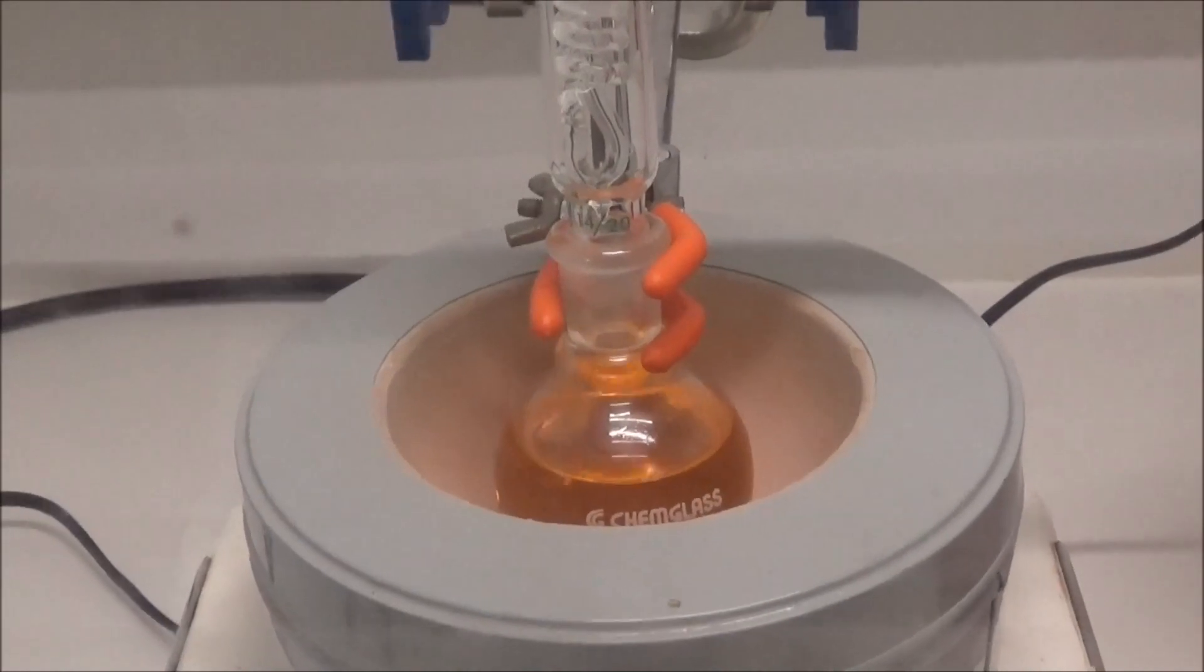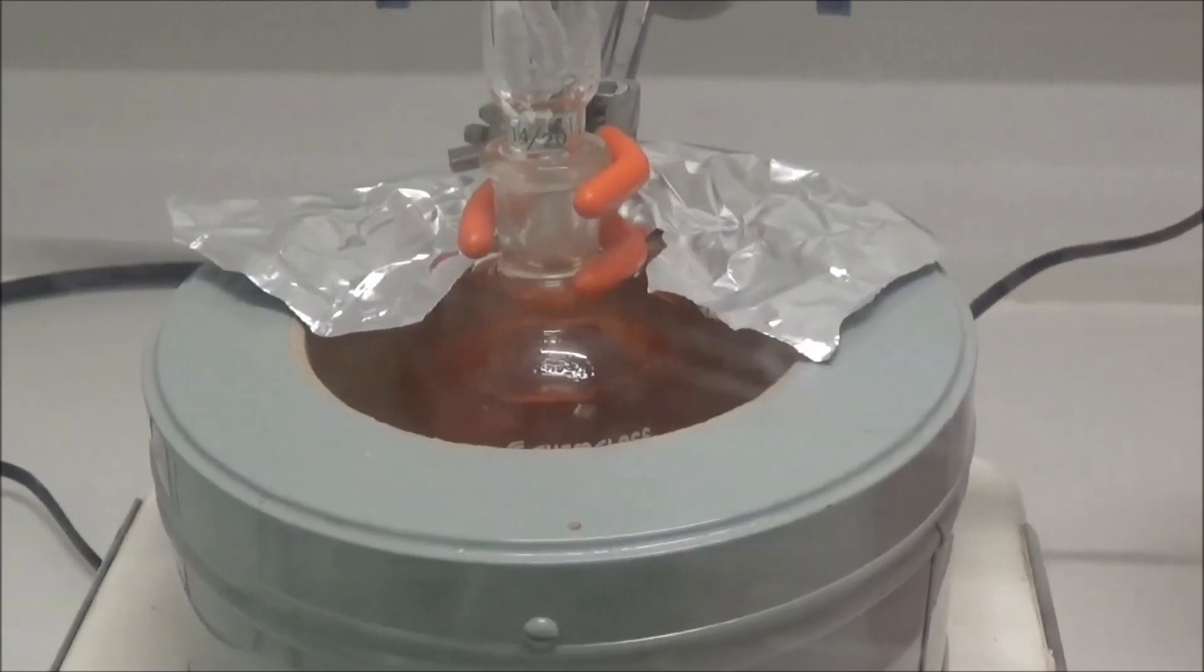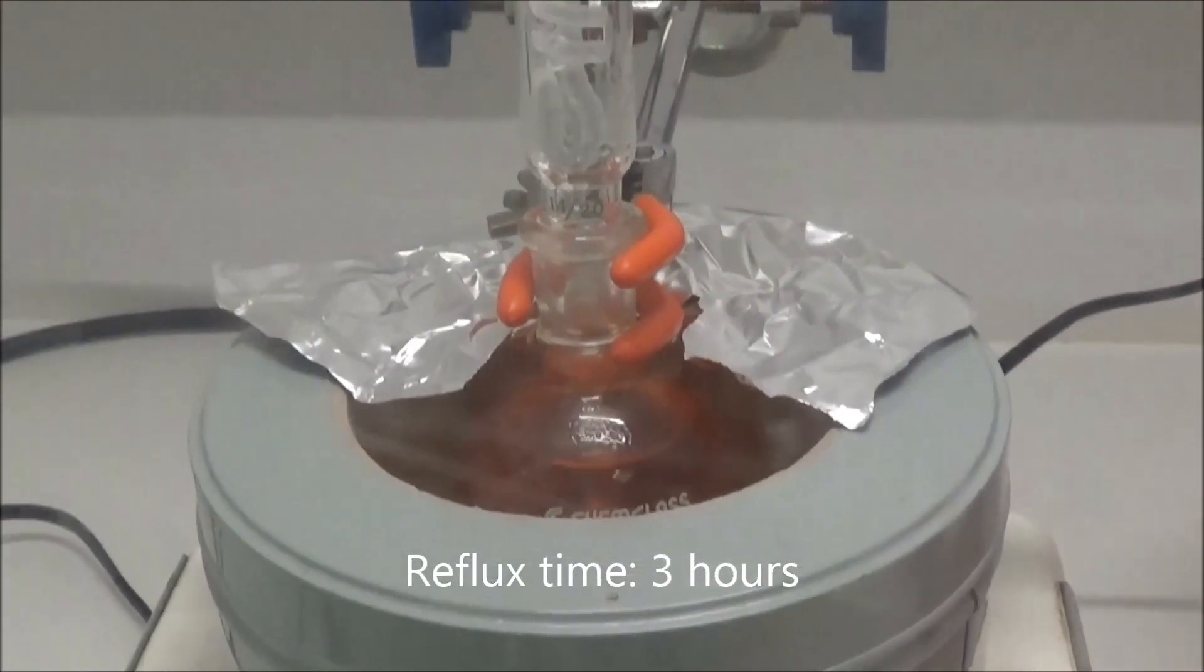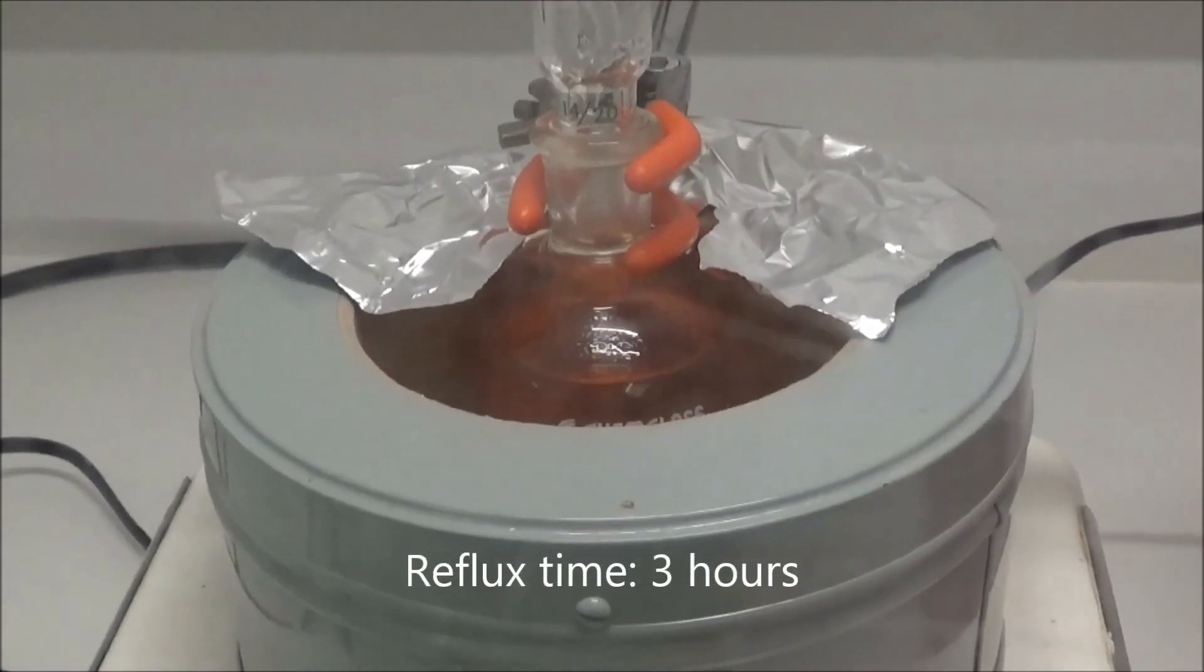Water flow was started in the condenser, and the heating mantle was turned on. Once the contents of the flask started to boil, I started the clock and refluxed the mixture for 3 hours.